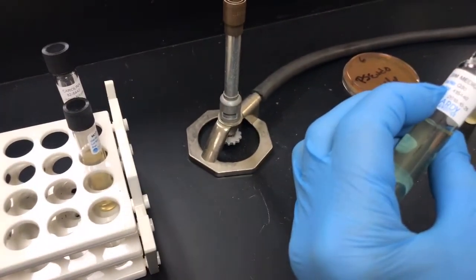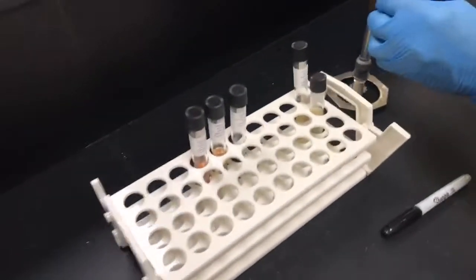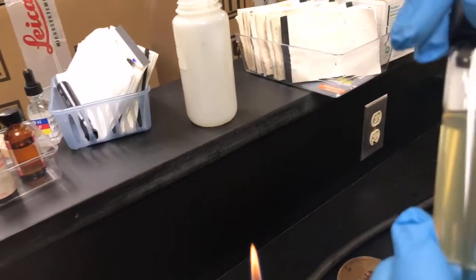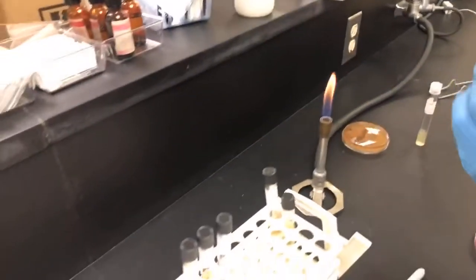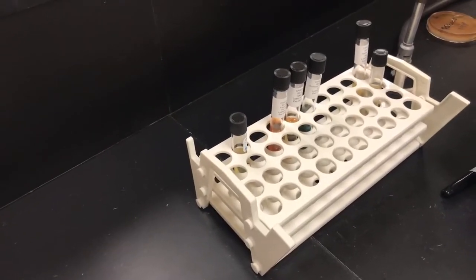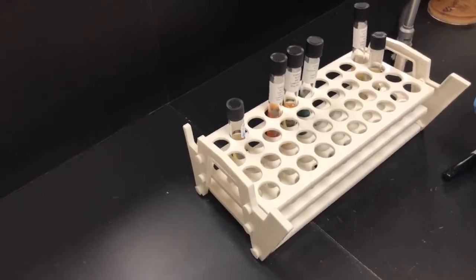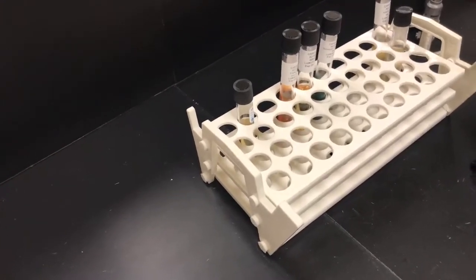I'm going to come right back out, same exact stab line. Yep, you go right in and right out. And he's gone down about maybe an inch or so. And let's see if we can see this. Not so much. But you'll be able to see when the bacteria grow. So the motility part of this, you're going to be able to see movement. If the bacteria has movement, it'll move away from the stab off to the sides, and you'll see those bacteria growing. If they don't have motility, they'll grow right around where the stab site is.